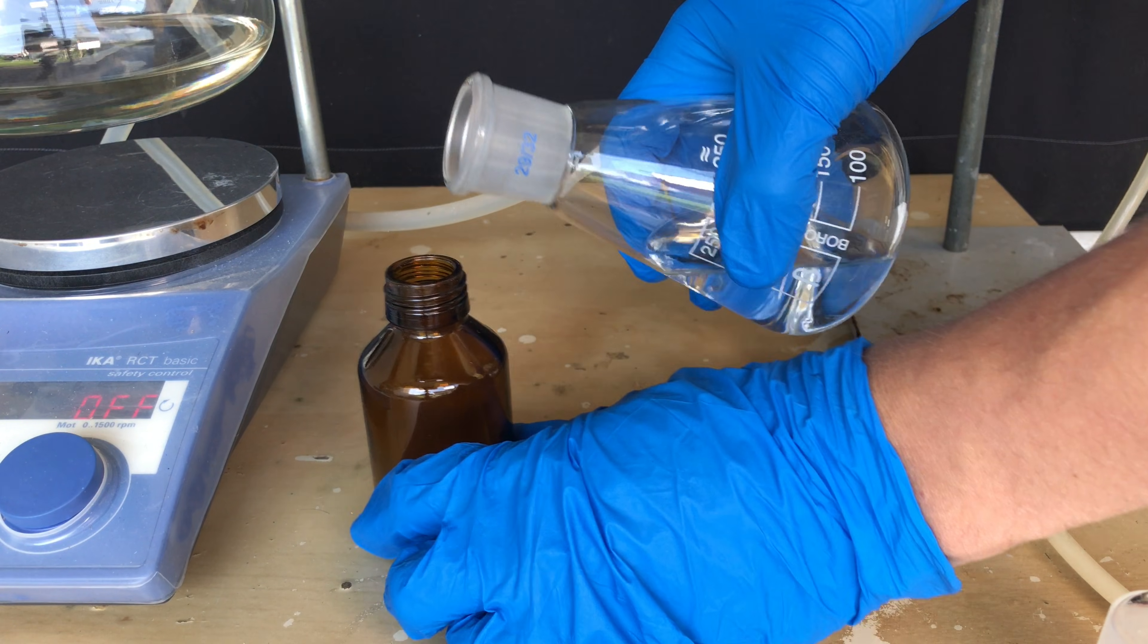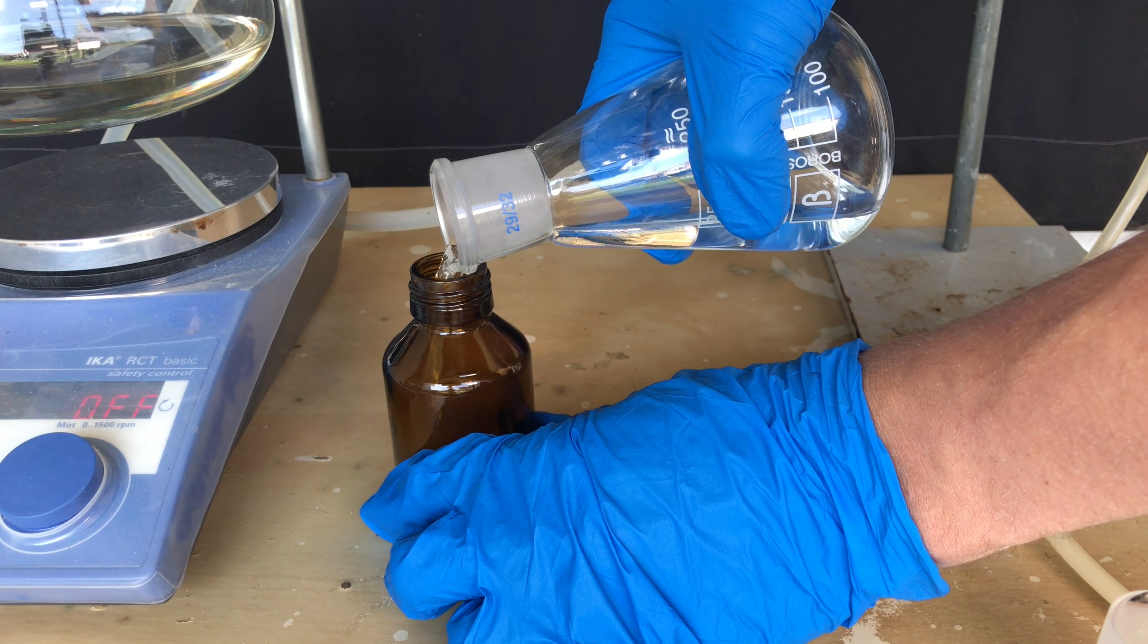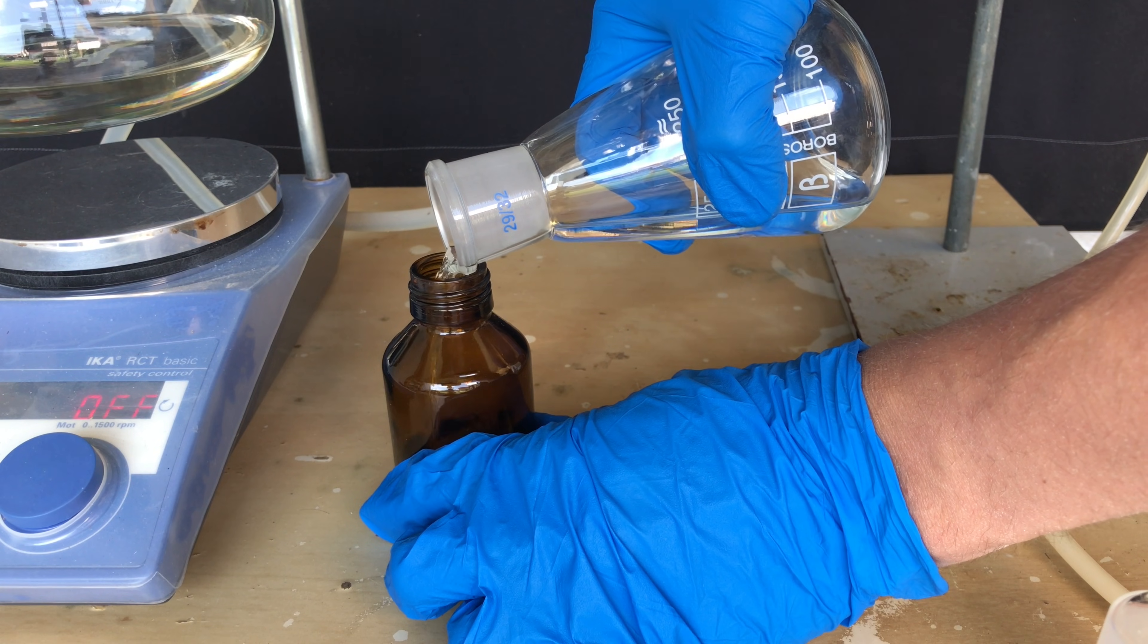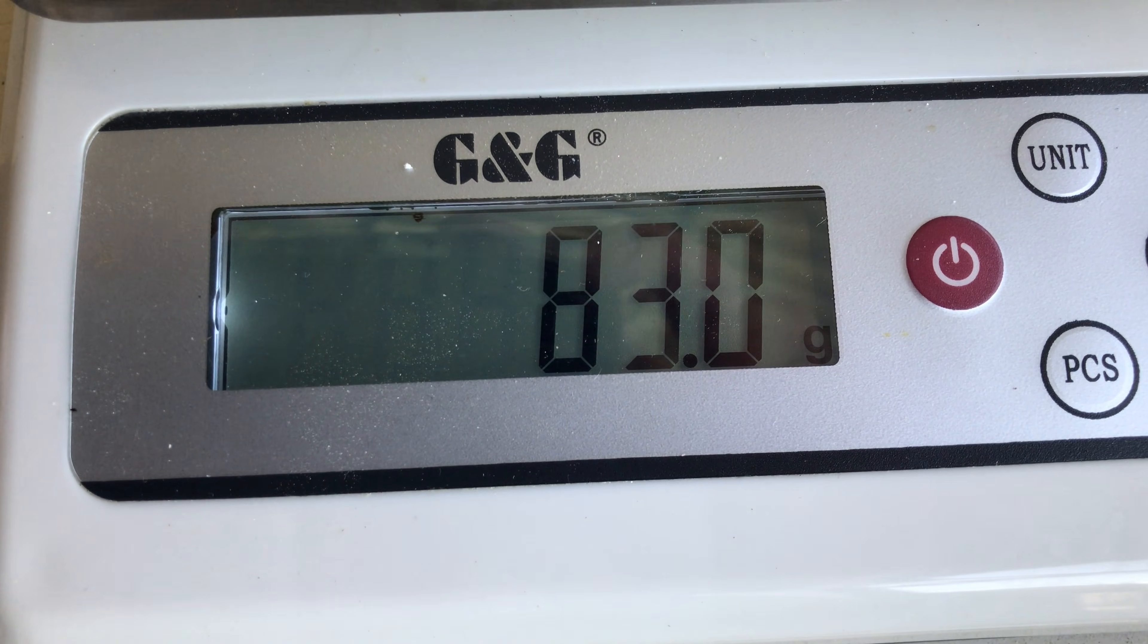It's a clear liquid which produces nasty fumes. For storing it you need to use a tight sealing storage bottle. Before filling it up I weighed it on a scale in order to determine the yield. We ended up with 83 grams, which represents a yield of 45%.